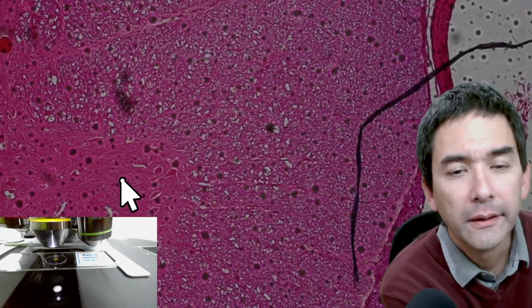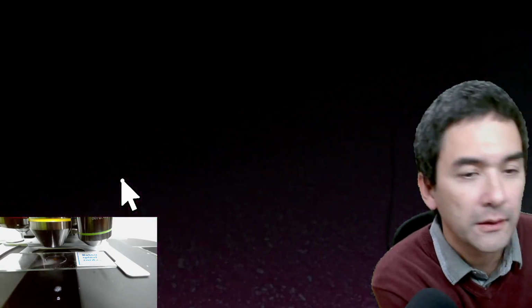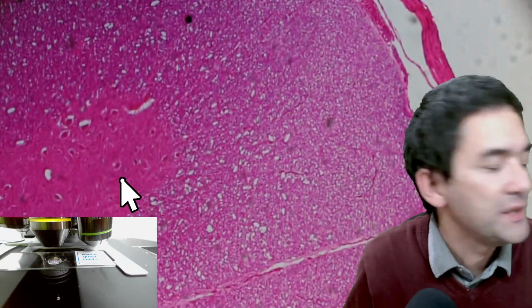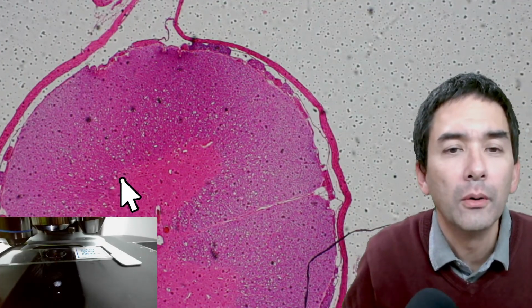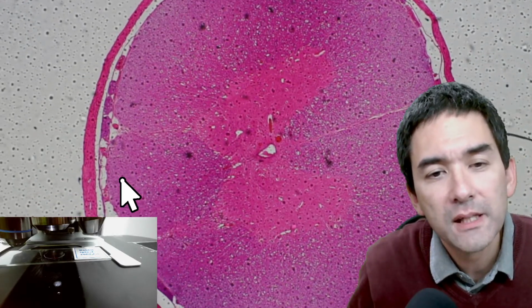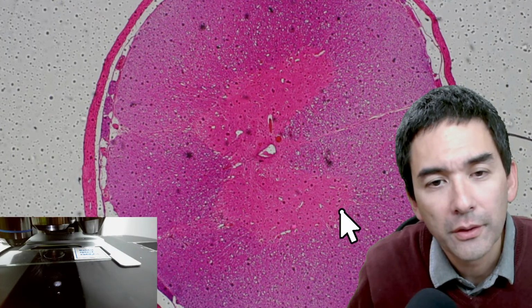Lots of cells running vertically, I suppose, and so let's try to make sense of what we see over here. It's too large, maybe. Let's swing it out. Yep, here we go. Very nicely visible, this shape over here.